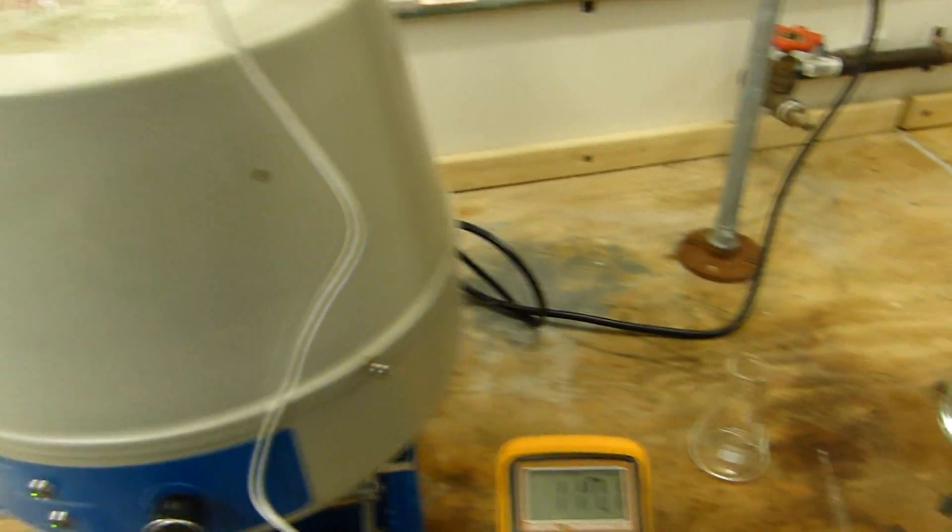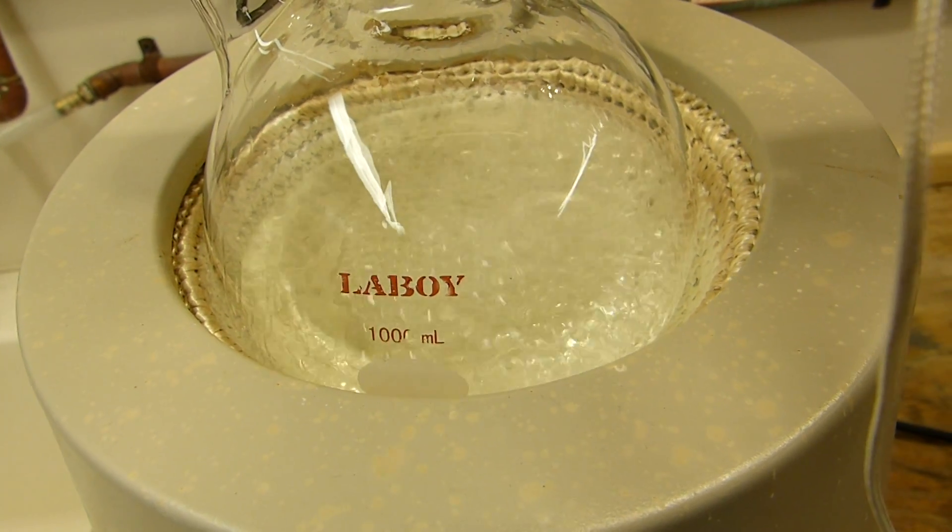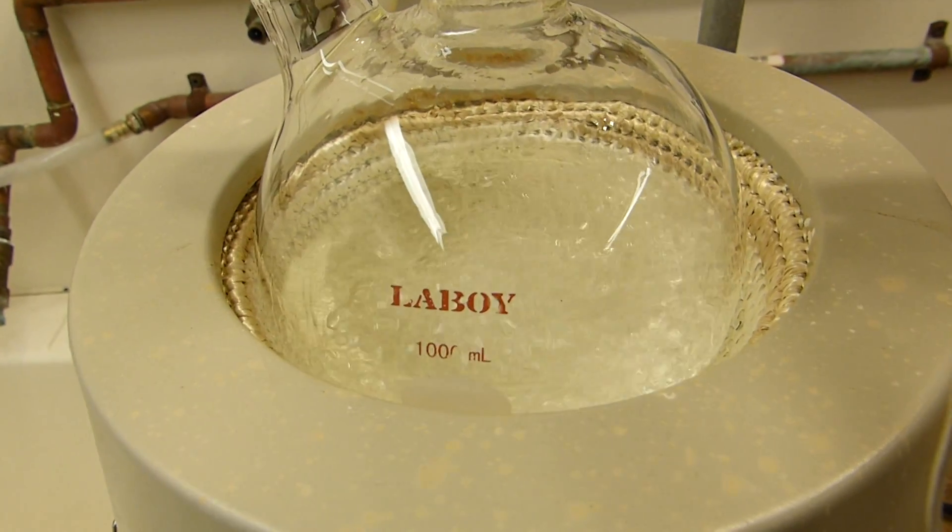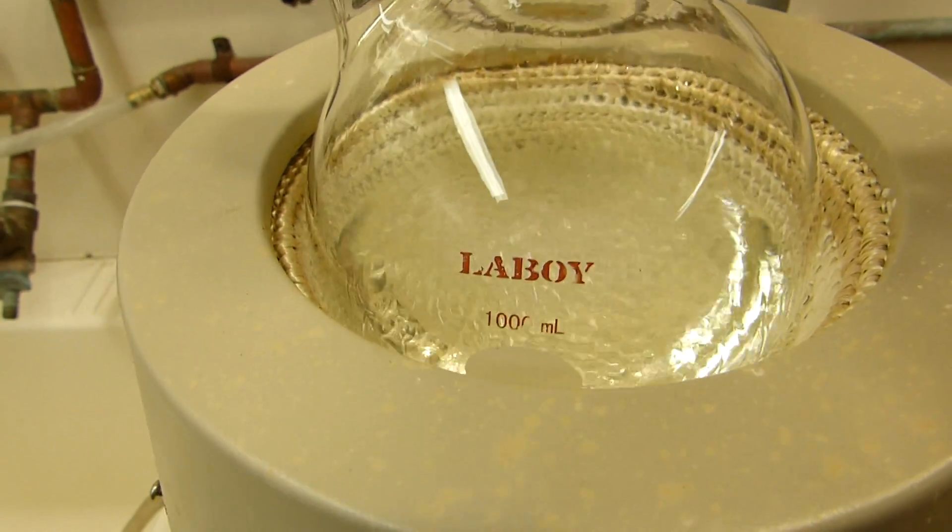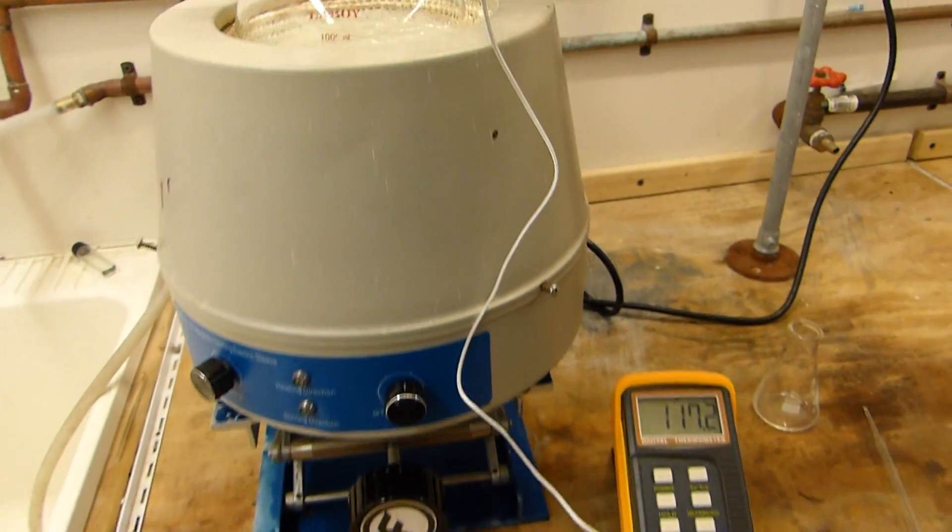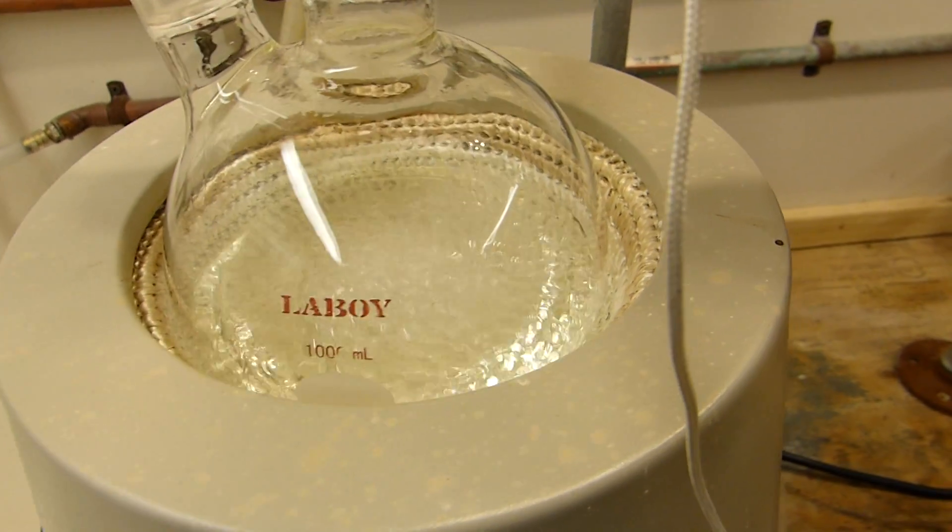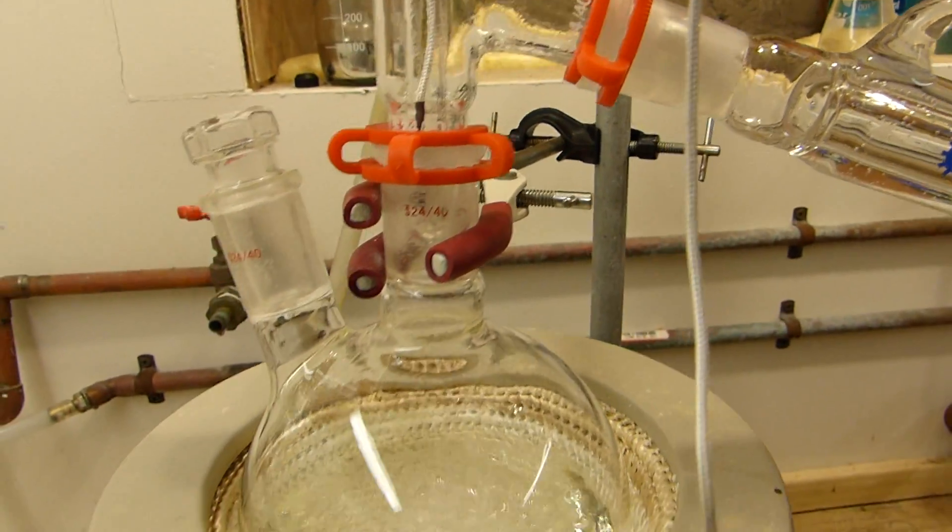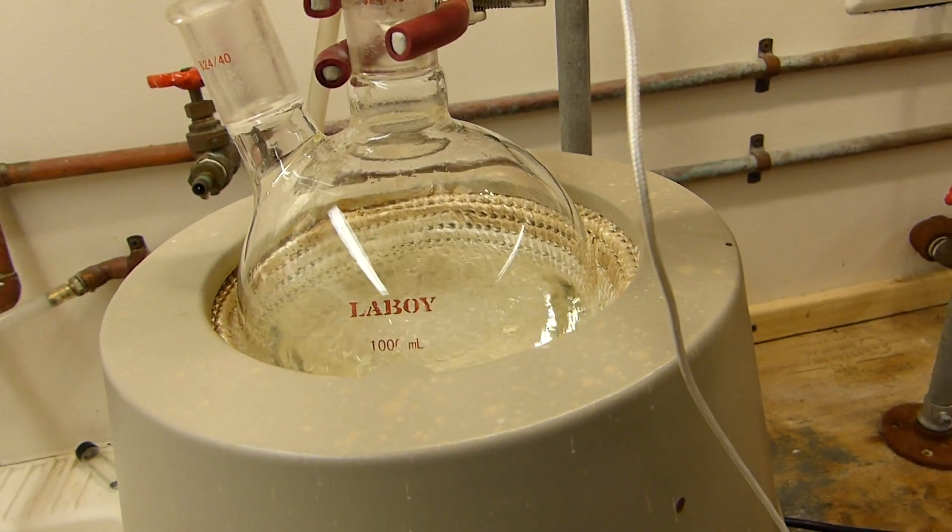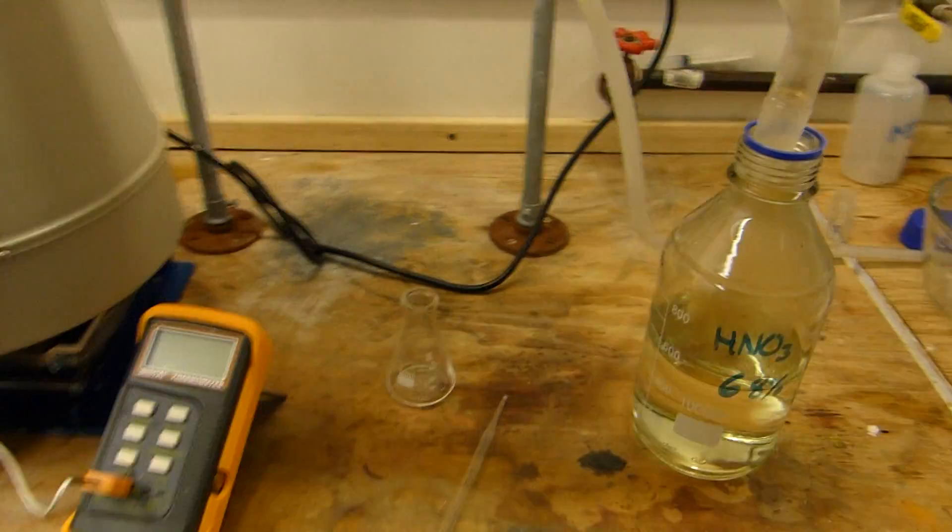Anyway, in here goes the 68% azeotrope stuff. And you can see up here that pretty much all the nitrogen oxides that were dissolved in that liquid are completely gone now. And all that remains to do is just to distill all of this out into here. Now you should never distill a flask to complete dryness, so I'm going to stop the distillation just before this gets dry. And if you do it correctly enough anyway, you can stop the distillation just as there's the last bit of liquid left in there and you waste pretty much nothing. And that's where a lab jack comes in handy because the reason you really don't want to distill to dryness with something like this anyway is because you'll end up heating the flask dry with the heating mantle and the difference in temperature could easily cause a flask to crack, especially if there's drip still coming down from the still head, which there may very well be. So in this case, simply having a lab jack and the ability to lower the mantle almost totally alleviates that problem. And I'm left with just a little bit of nitric acid at 68% and a whole lot more over here.